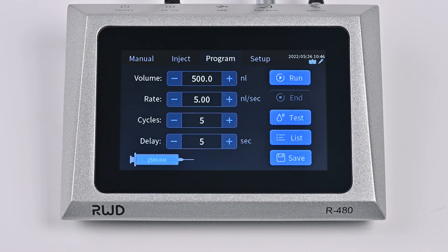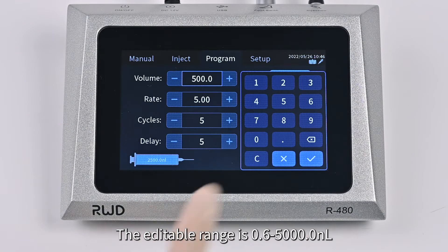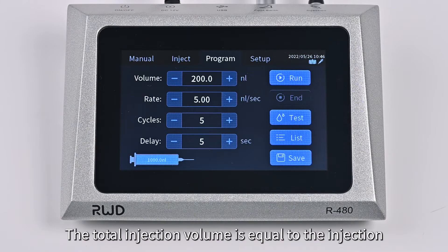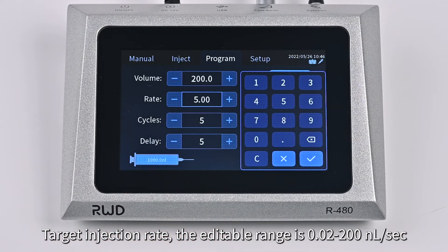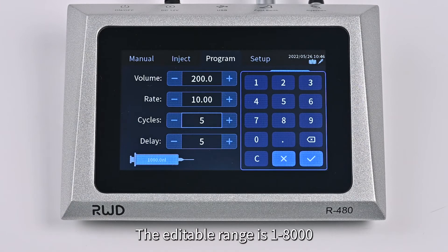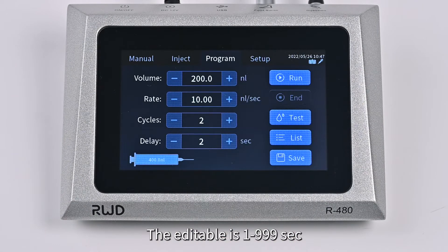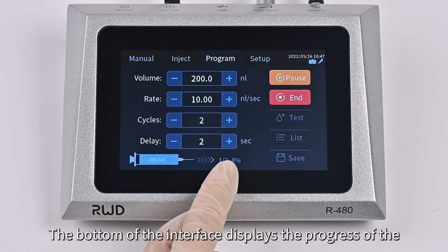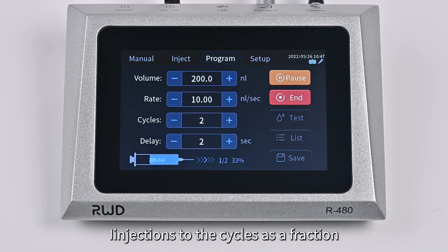Enter the Program interface. According to the experimental needs, set the target injection volume; the editable range is from 0.6 to 5,000 nL. The total injection volume equals the injection volume multiplied by cycles. Target injection rate: the editable range is from 0.02 to 200 nL per second. Cycles represents the number of repeated injections; the editable range is from 1 to 8,000. Delay sets the length of the interval between two cycles; the editable range is from 1 to 999 seconds. Click the Run button and the instrument starts the injection according to the program. The bottom of the interface displays the progress as a percentage, and indicates the ratio of the current number of injections to the total cycles as a fraction.